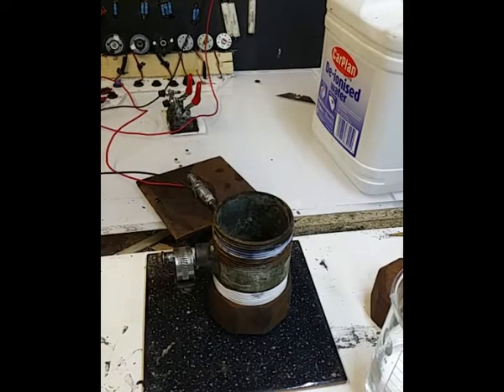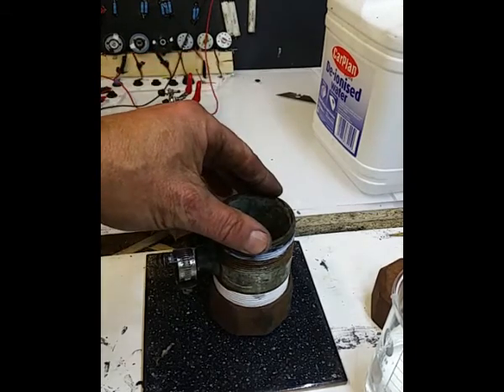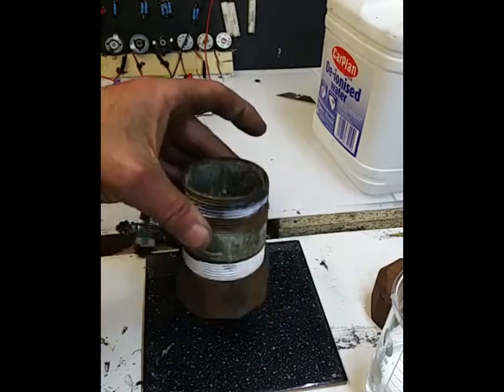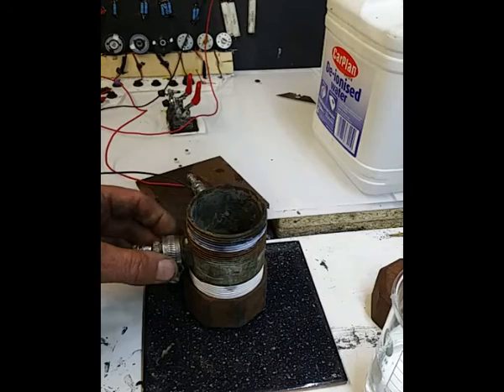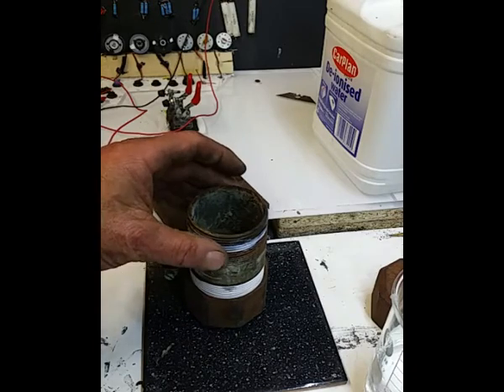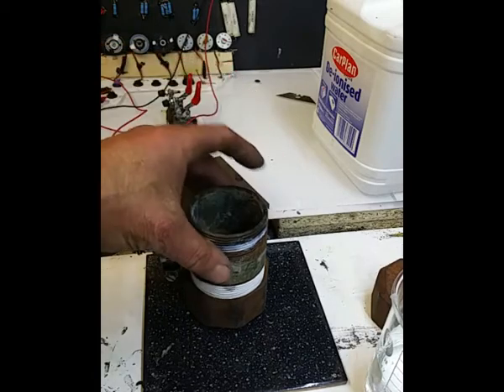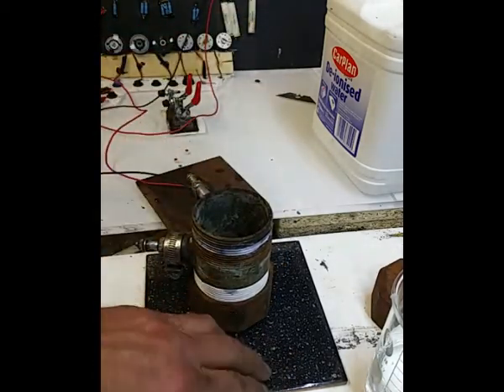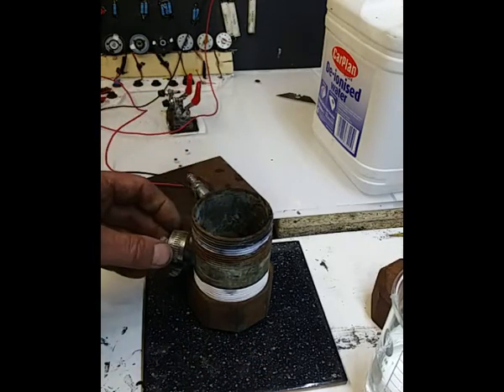So yeah, let's give it a go. What I'm going to do is put some water in there and start it. Obviously it may take quite a while to heat up, so what I will do is put some heated water in it, and then stand that on the hot plate. You don't need a tile, just stand it on your hot plate or whichever method suits you best.